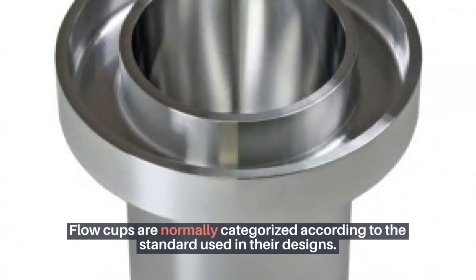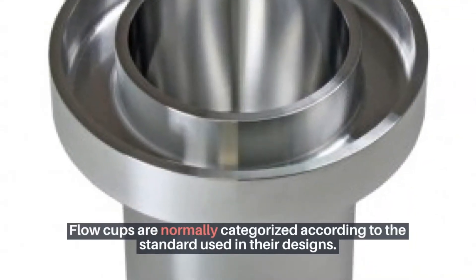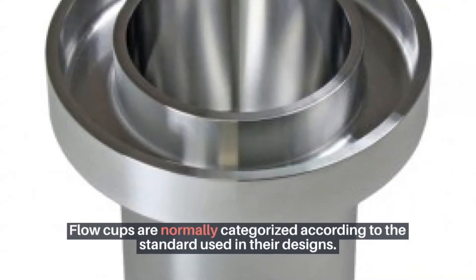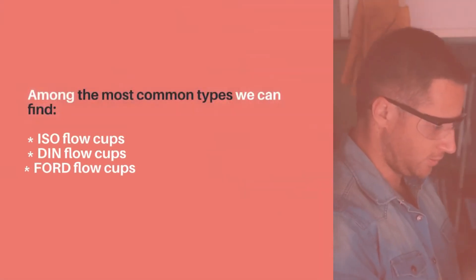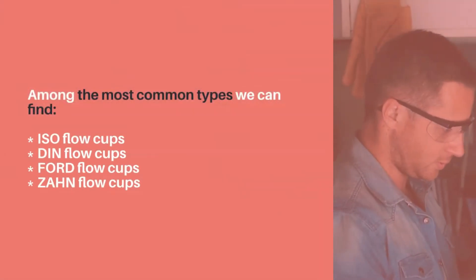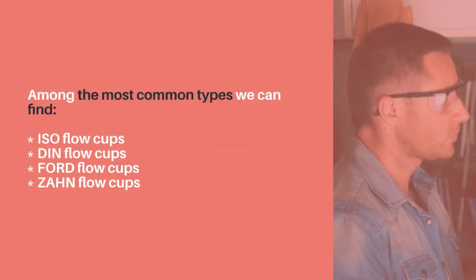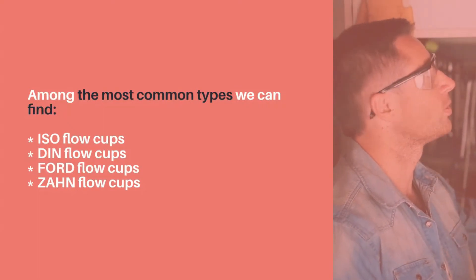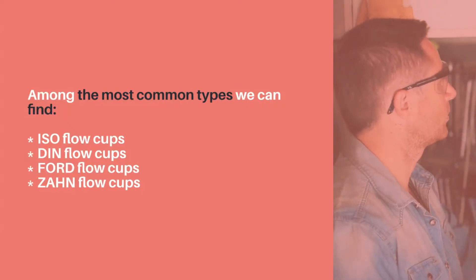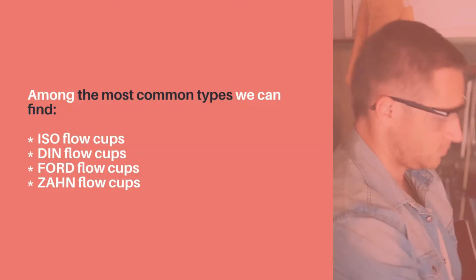Flow cups are normally categorized according to the standard used in their design. Among the most common types we can find: ISO flow cups, DIN flow cups, FORD flow cups, and ZAHN flow cups.